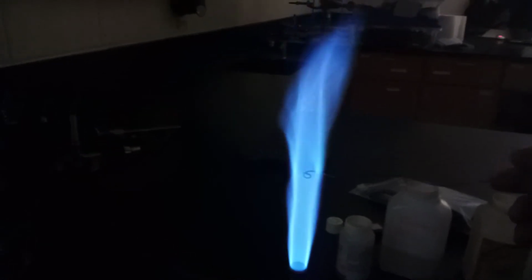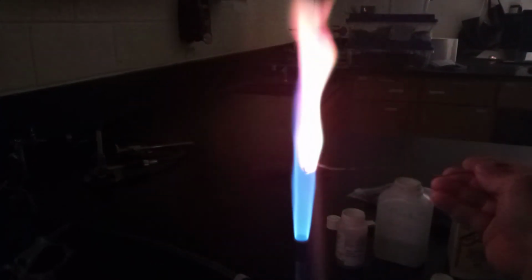Now again, we need a written analysis. We're looking for the green color here. Where's the green? There it is. And it's hard to see with the lights off a little bit, but it's a really nice green color. All right, so what are we doing for this lab? Identifying the unknown substance. Let's try the unknown substance quick one more last time with the lights off. And there we go. I see some green, some red. You can be the judge of what you see. Might not be the easiest in the video.